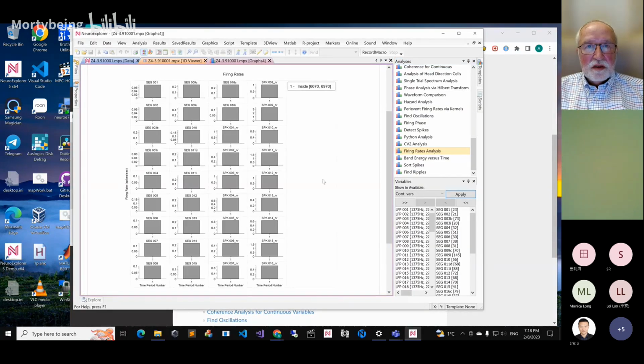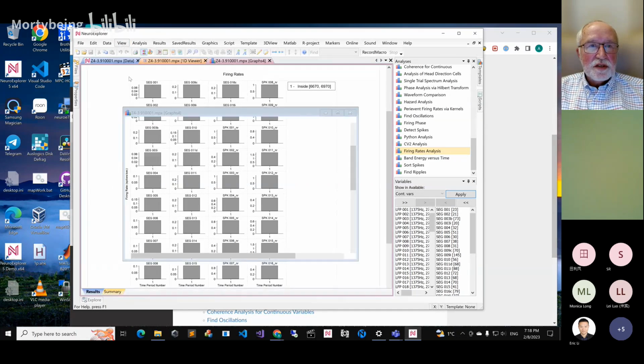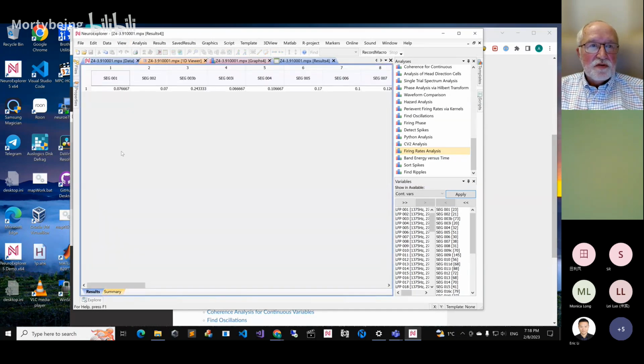Okay, selected variables. Okay, go. So it shows you numerical results. The main results you want are numerical results. So go to view, numerical results, and this shows you the firing rate of each of those channels. For the original ones, it's very low, and now with the NR, they are much higher. So we have like one spike per second. So this is how you get the firing rates.